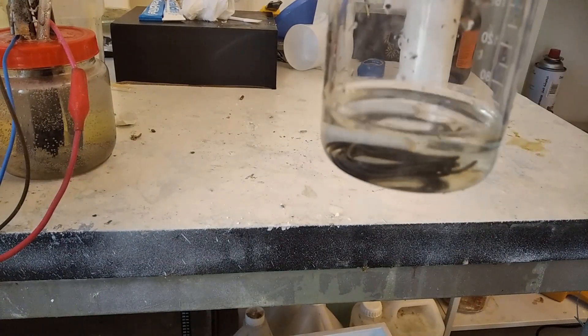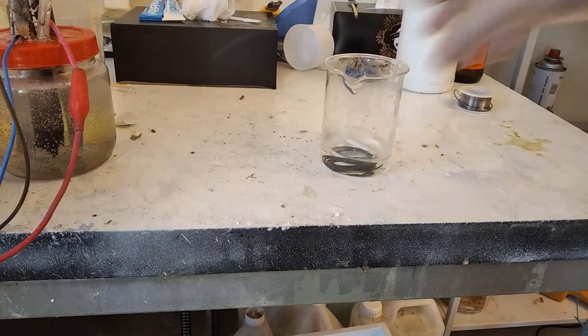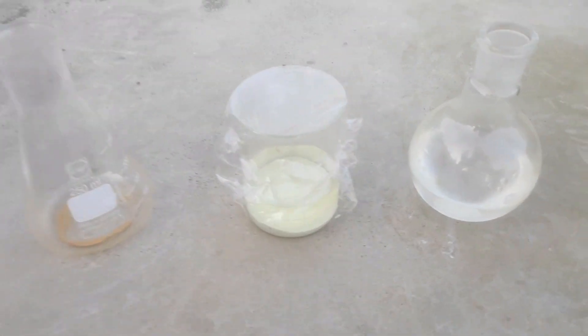You want to heat this up, but I'm not going to heat this up because I don't really have time to do it outdoors. I'm going to leave this at room temperature. In the very next step of this video you will see the completed reaction mixture, and if you've seen part two of my video you know how this looks once you actually heat it up. So I'm keeping it at room temperature — now we're somewhere else entirely.